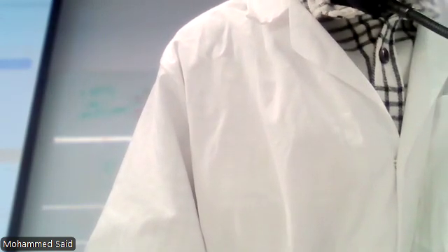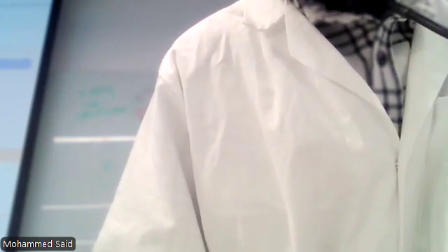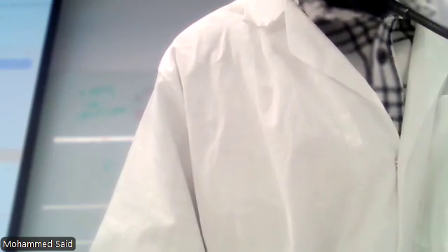How many of you are doing your conjugation right now? Group 5. Group 4, are you done conjugation? You done all three? Conjugation, transformation, plaque assay? Like the third plate for conjugation, is that done as well? No? Okay, so complete it now.